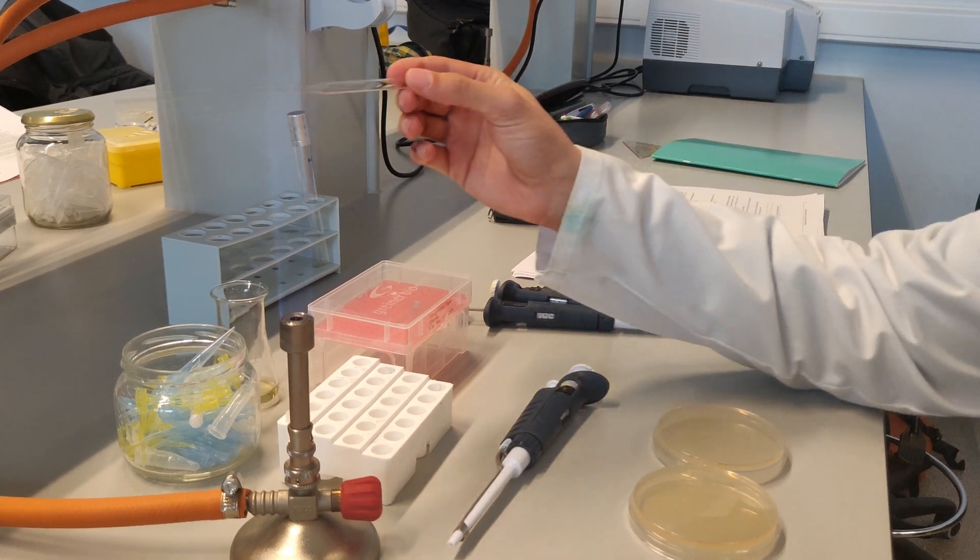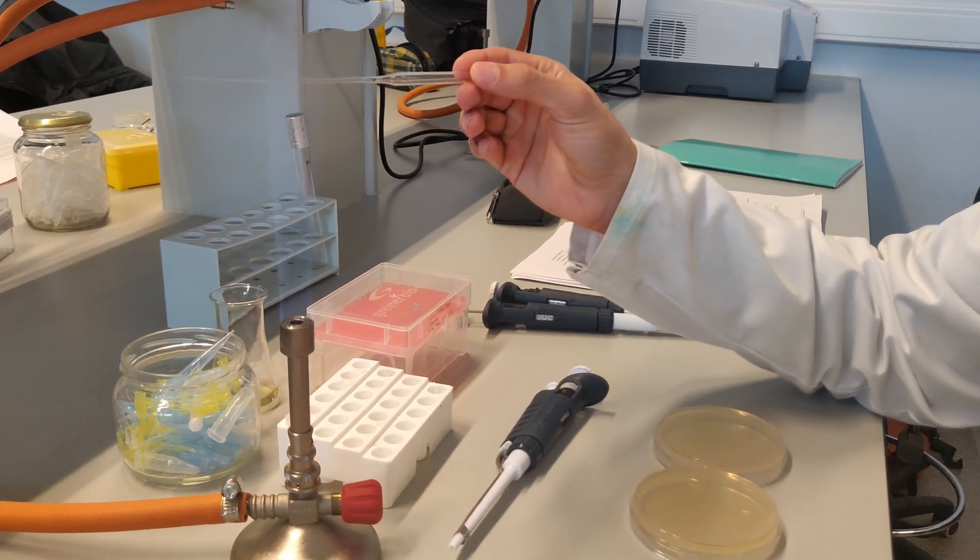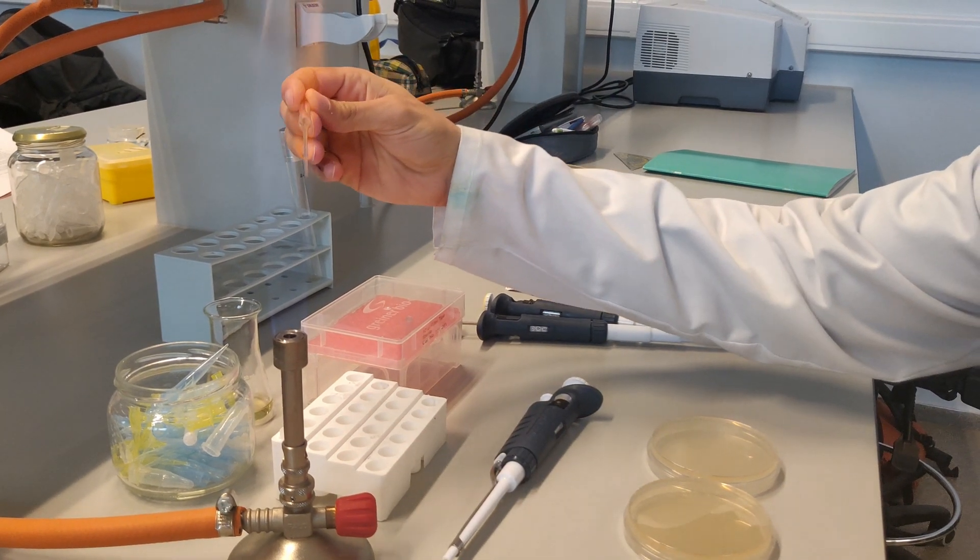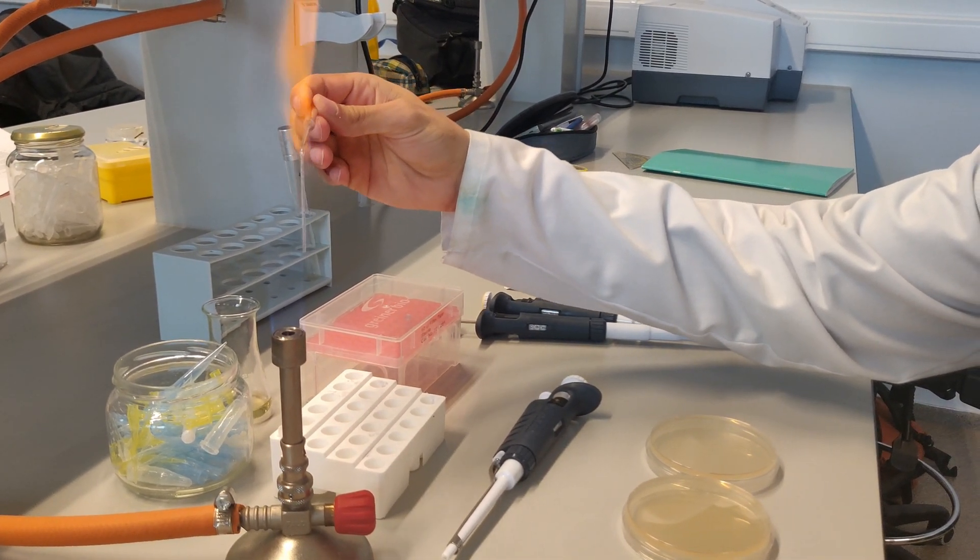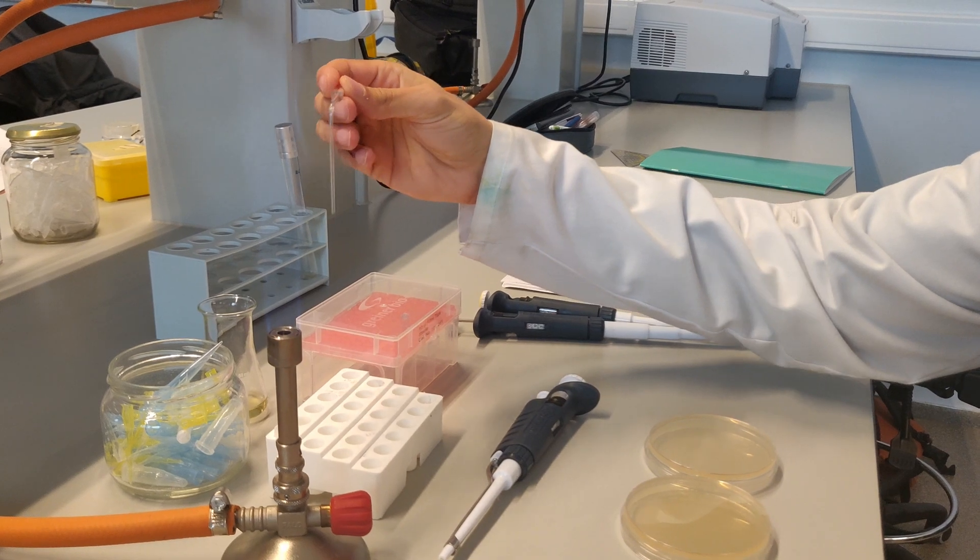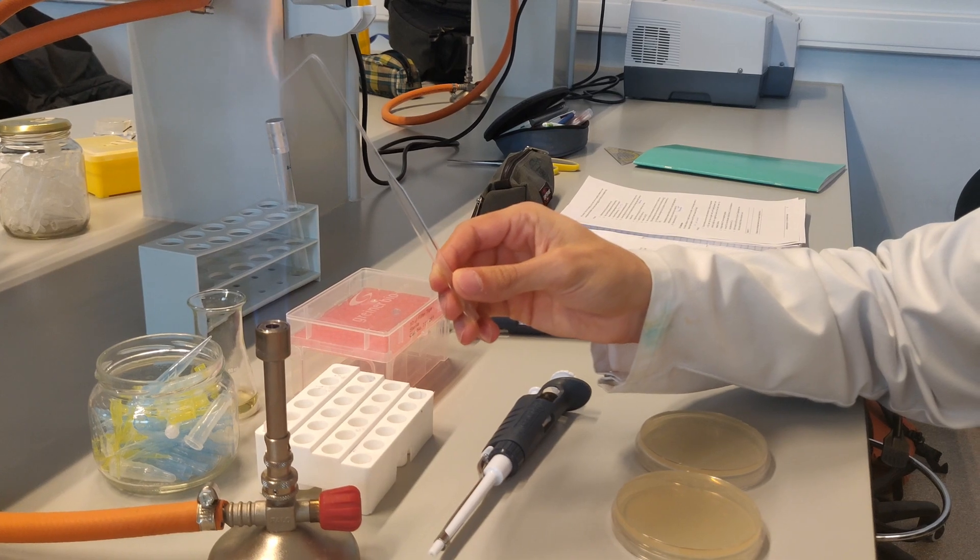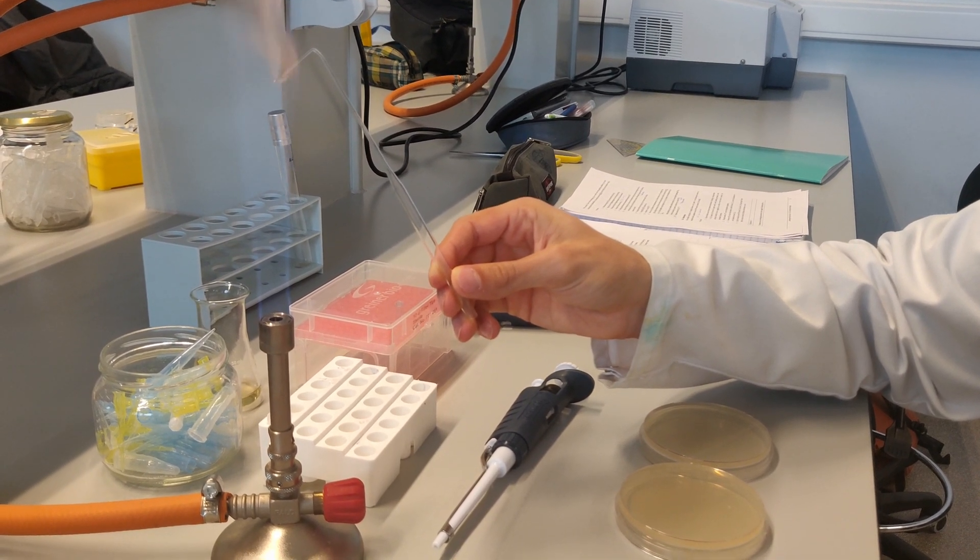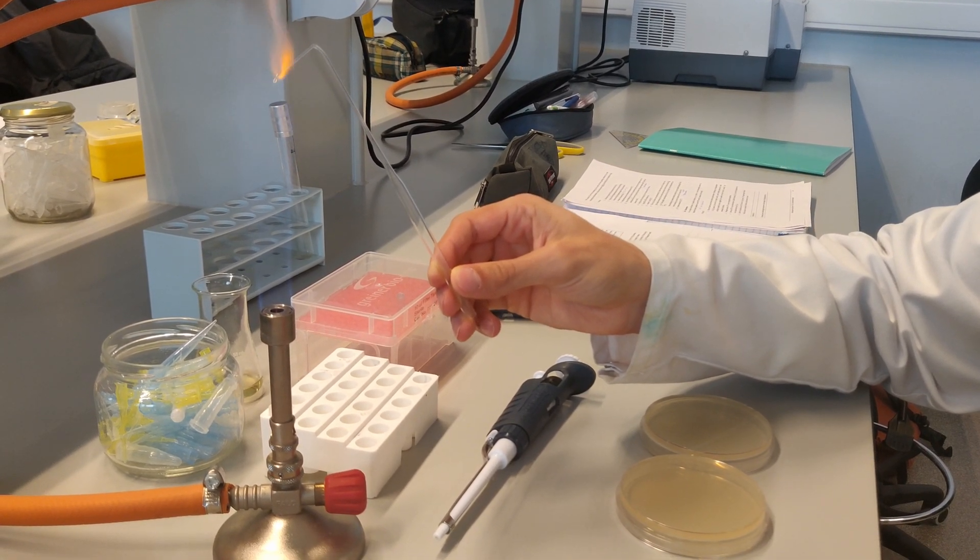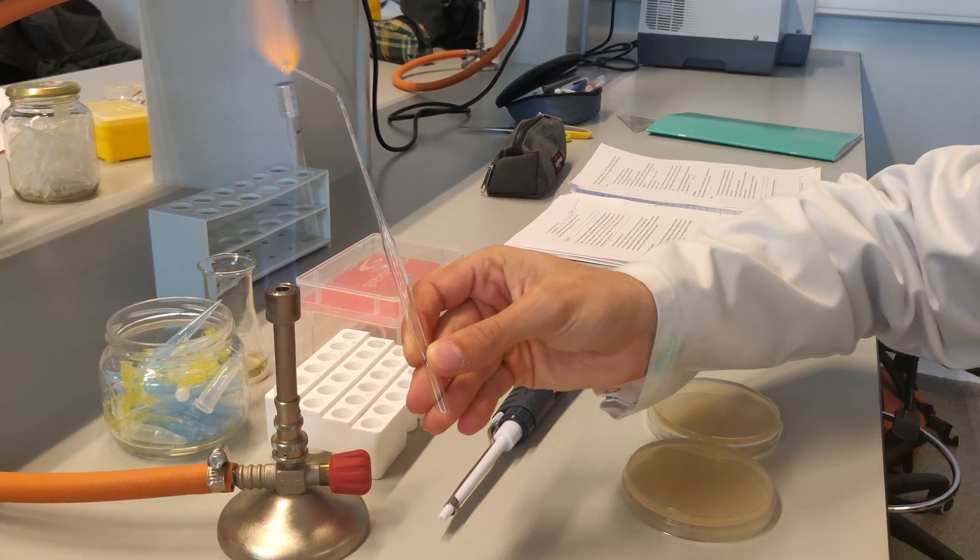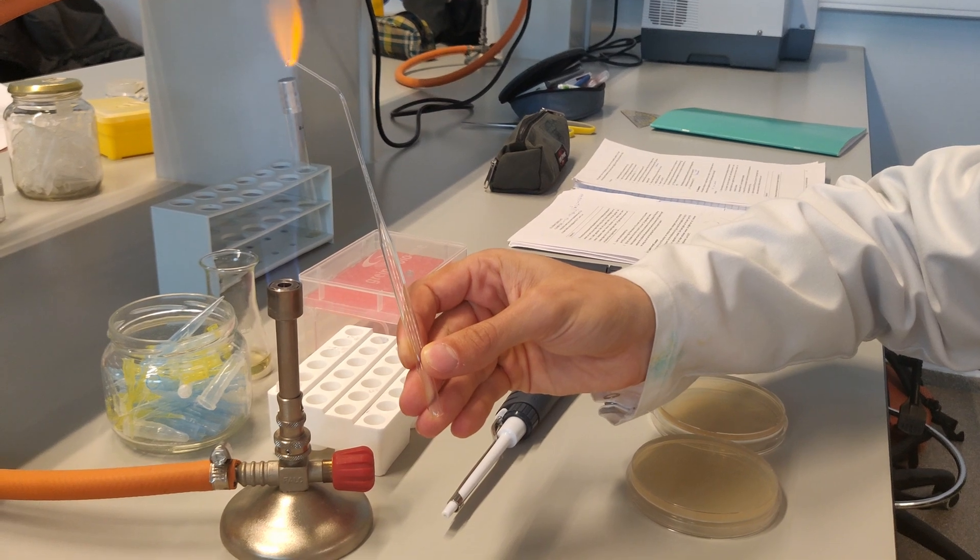Here I'm modifying a Pasteur pipette to plate the solution.